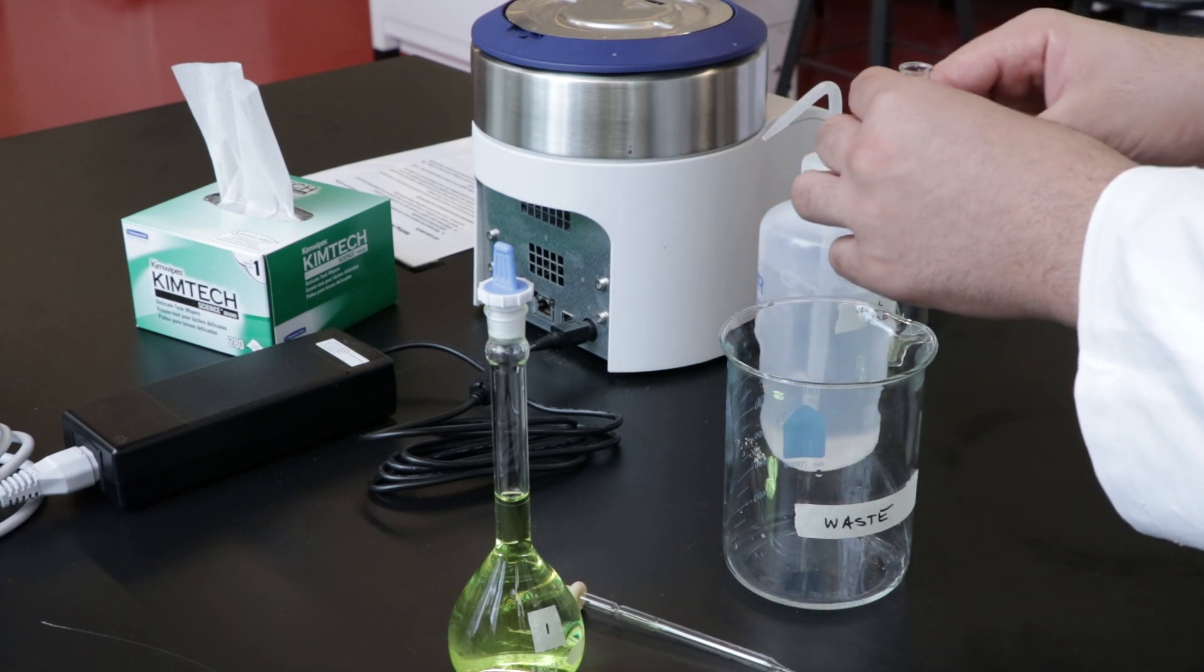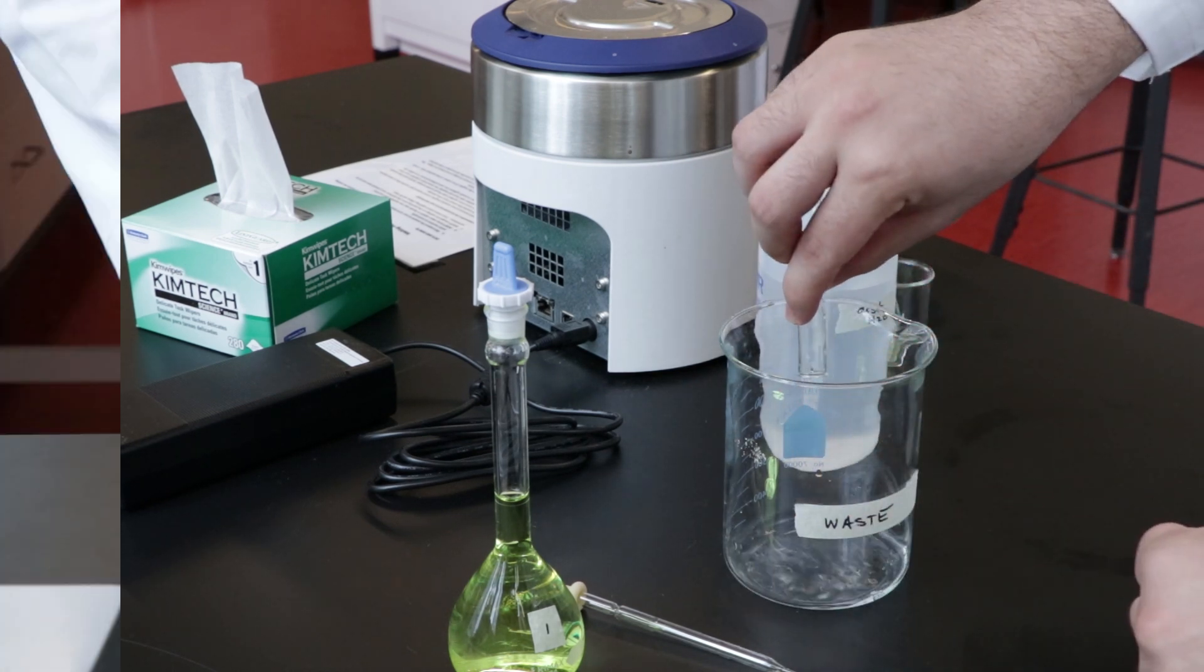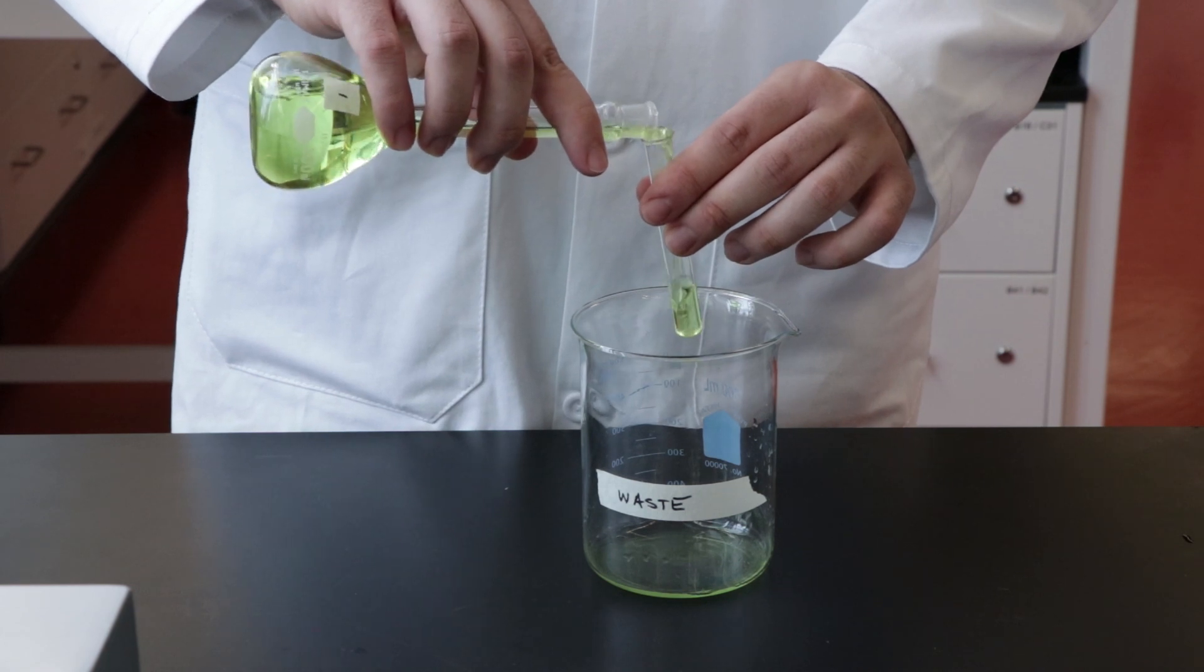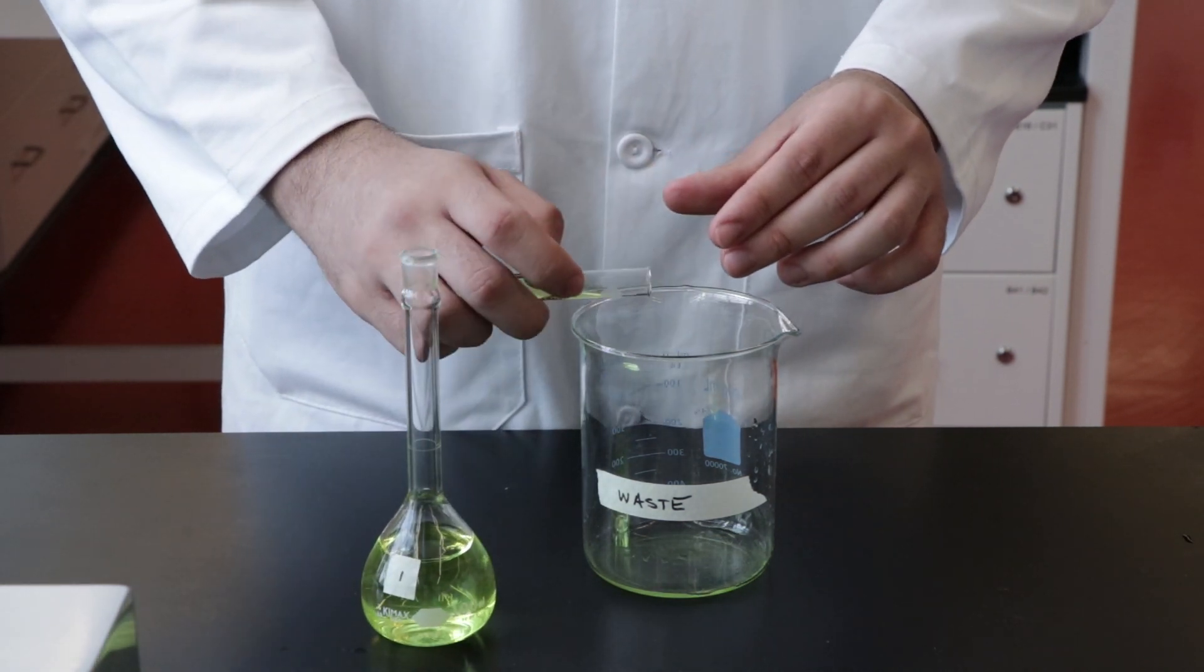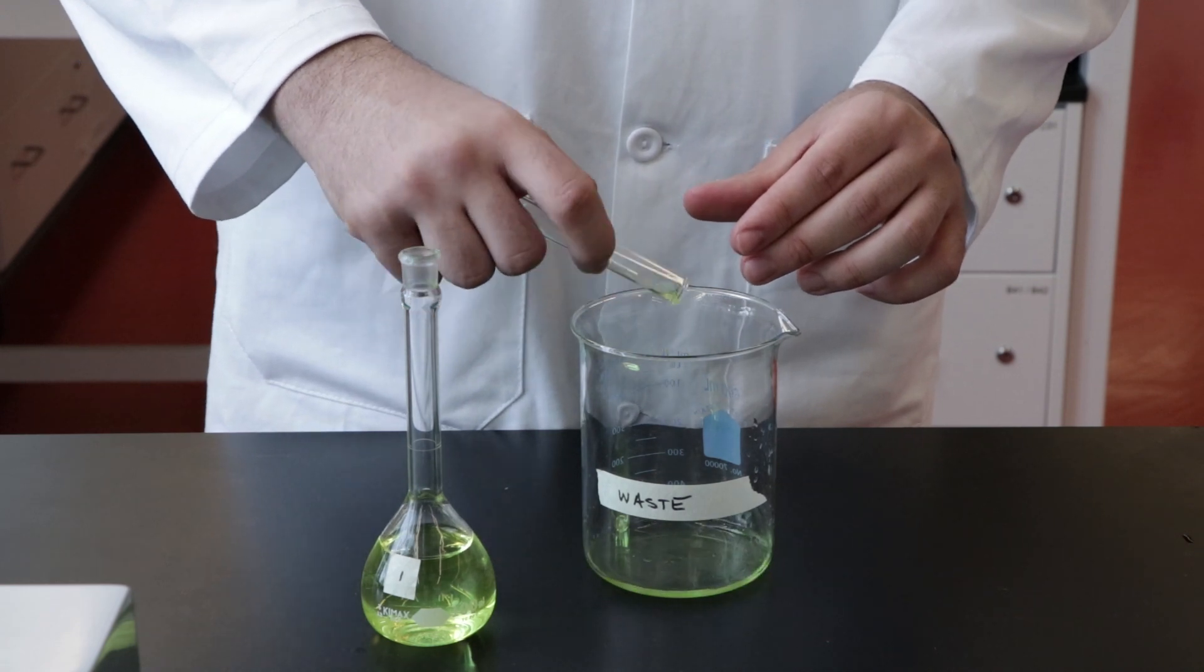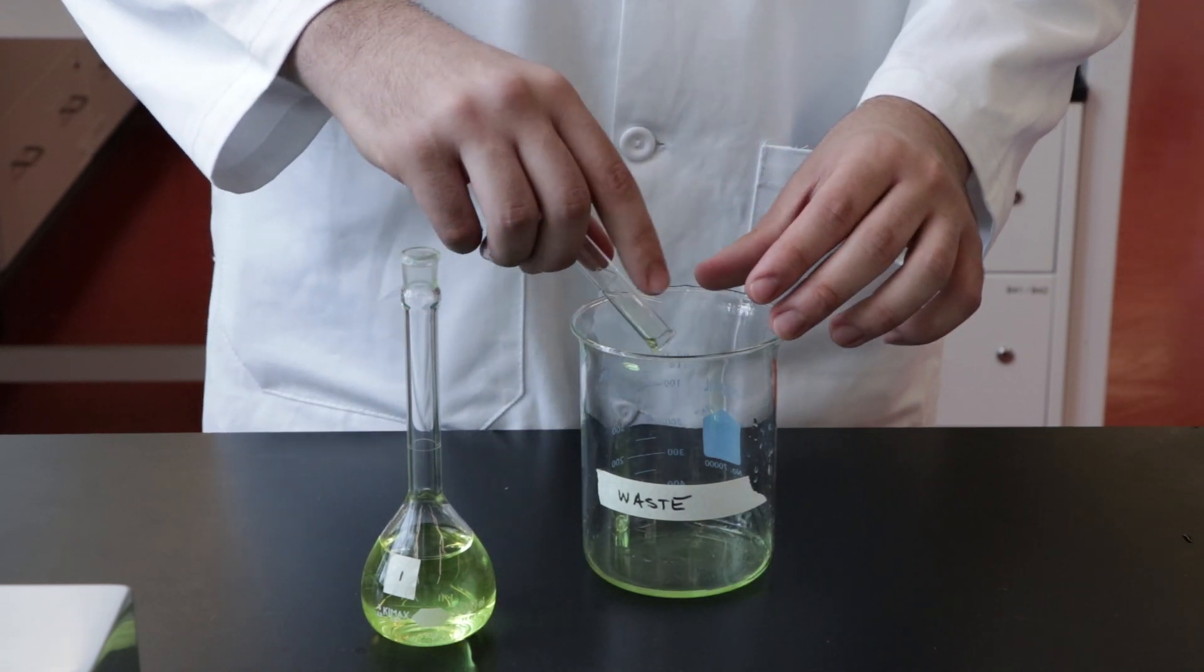After each reading, rinse the cuvette three times with distilled water and three times with the next solution to be analyzed over a waste beaker. You will use the same cuvette for all your readings to ensure that the path length remains consistent.